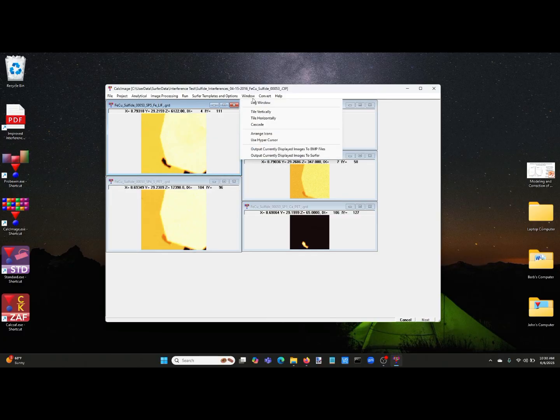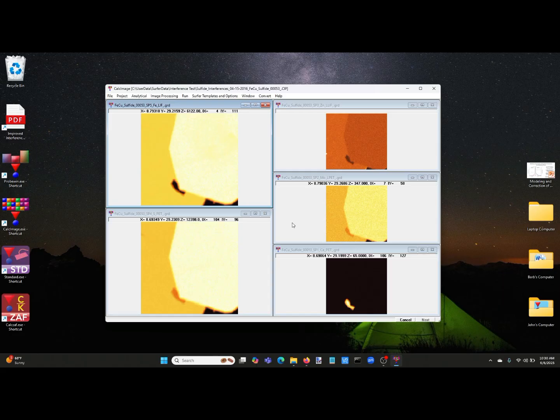And what we will notice here is that it appears, this is our molybdenum map right here, you can see the molybdenum right here, and it looks like we're getting two different levels of molybdenum in these two different sulfides. One's an iron sulfide and one's a copper iron sulfide. Should be pretty obvious which is which.